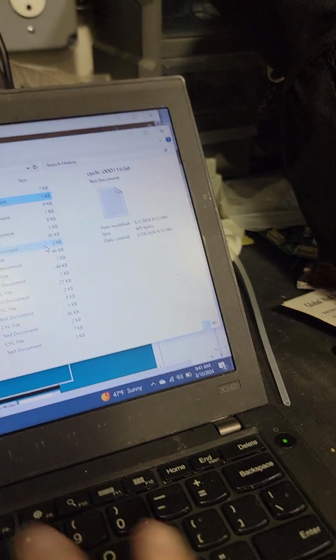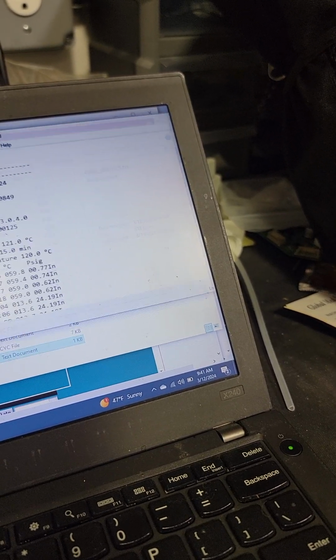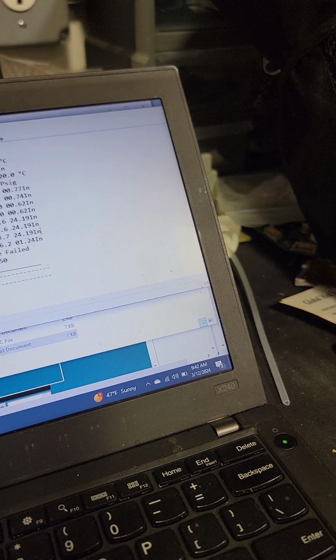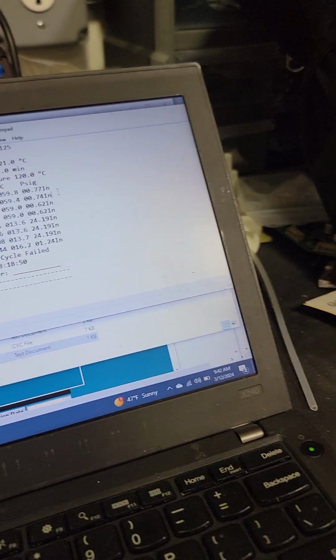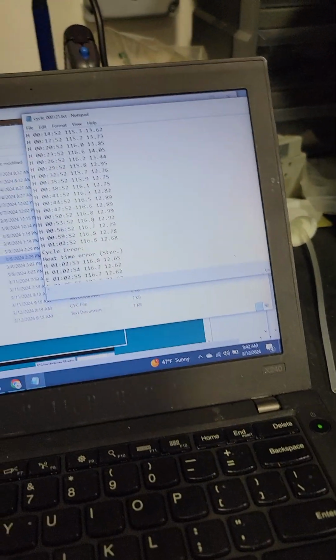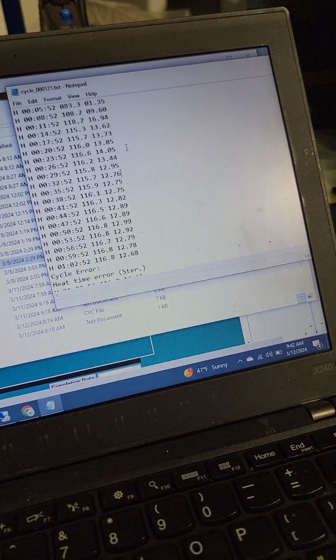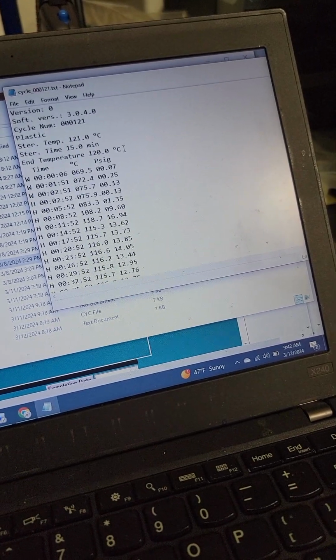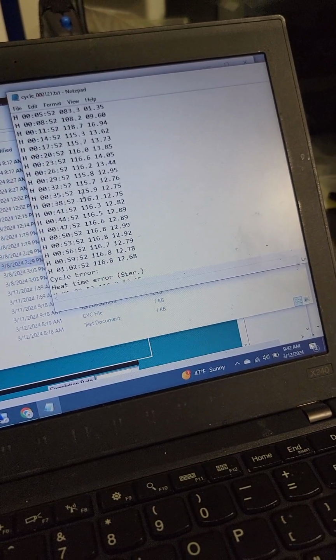On to the next one. Go for the last one here. 312. Okay, cycle failed. Those are the ones we were looking for. Alright, I don't know what those cycles were. Anyway, I probably just shut the power off at some point because I'm drinking water. So here's the cycle data I was really looking for. So heat up, where we get stuck.